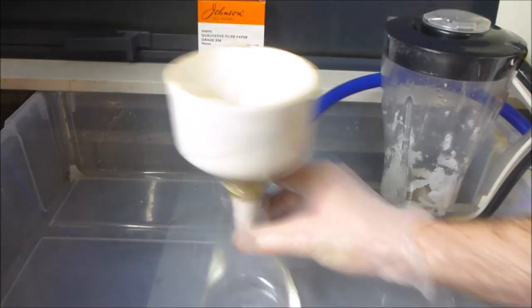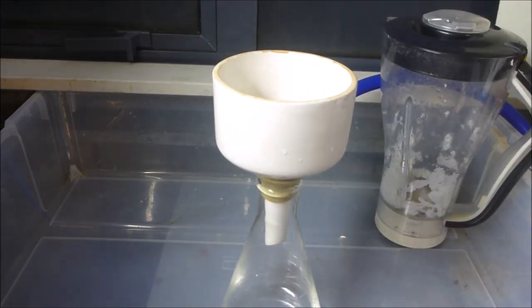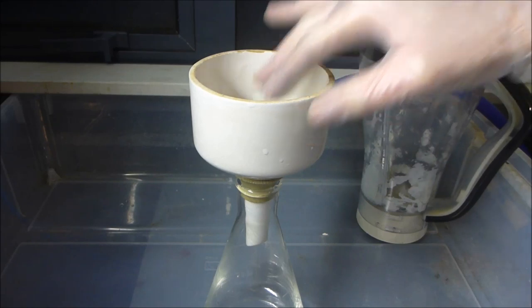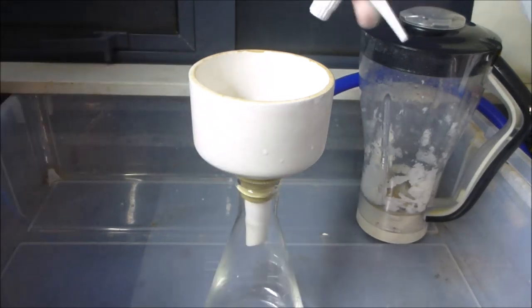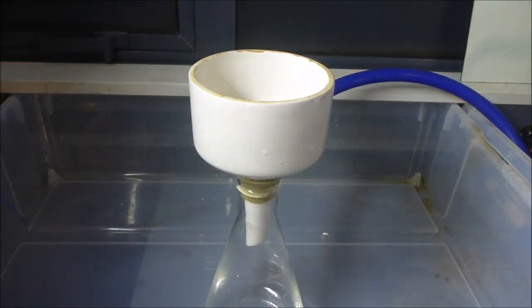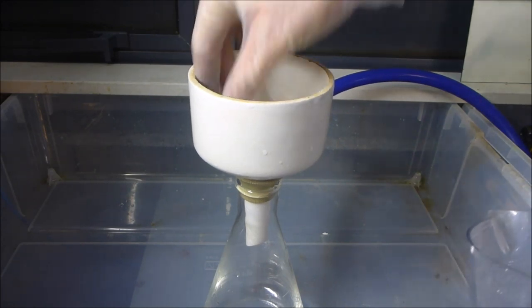And bring the old Büchner funnel in. So we're just going to grab a regular filter paper. Okay, position that. Get some vacuum going. And just spray it down as normal. Okay. Then without the vacuum going, we want to take our mushy mushy paper and just kind of evenly distribute that. Kind of looks like that. Just evenly distribute that over the top.